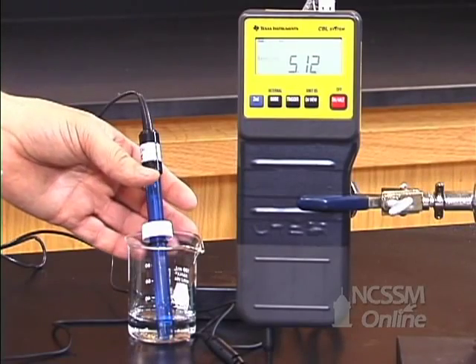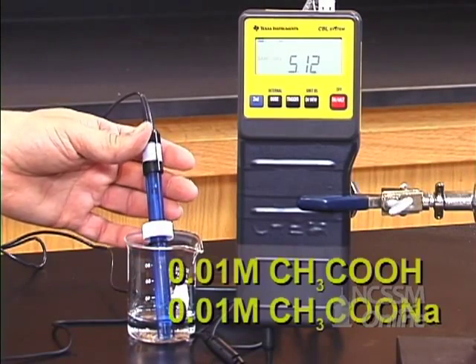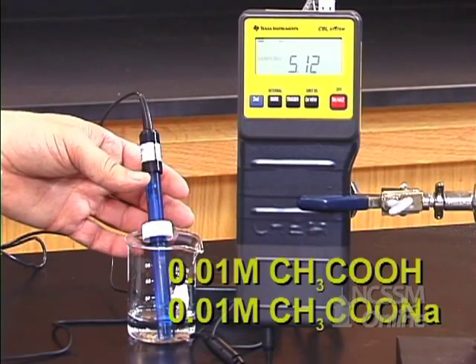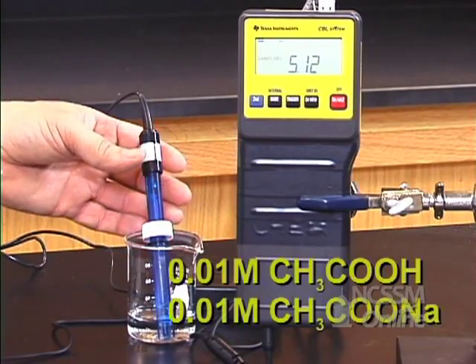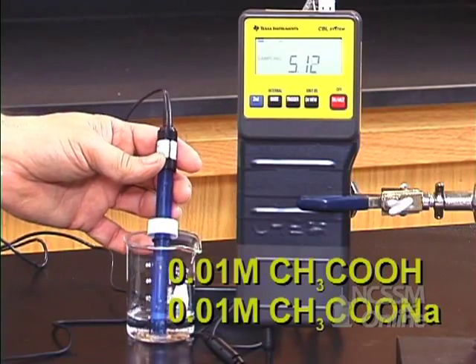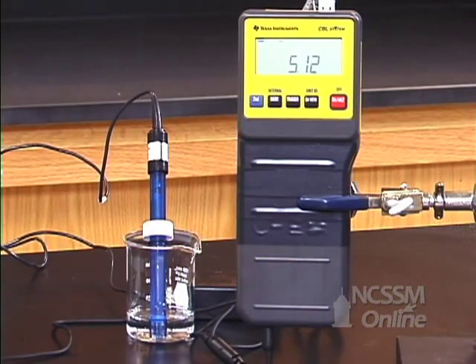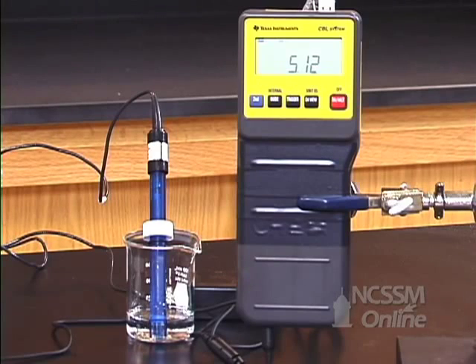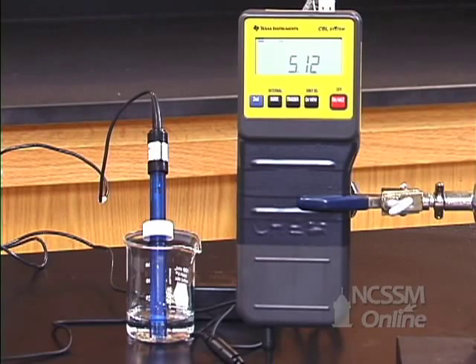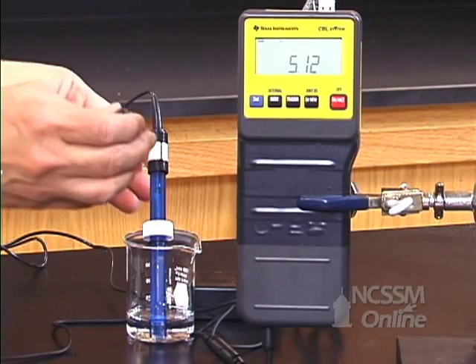I have a new sample of the 0.01 molar acetic acid, 0.01 molar sodium acetate buffer mixture. I am now going to add 1 molar sodium hydroxide to this solution.